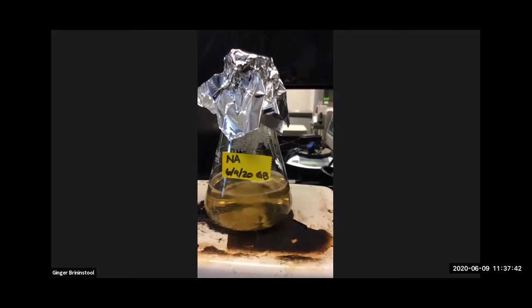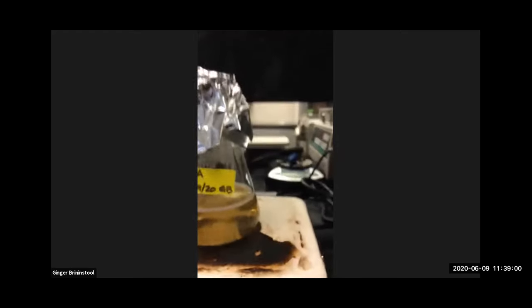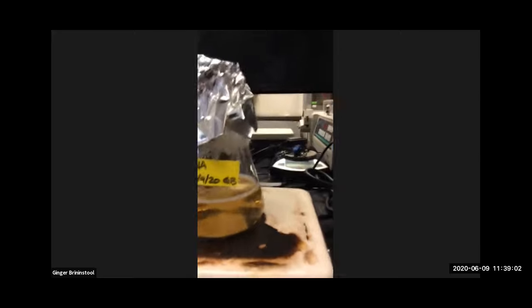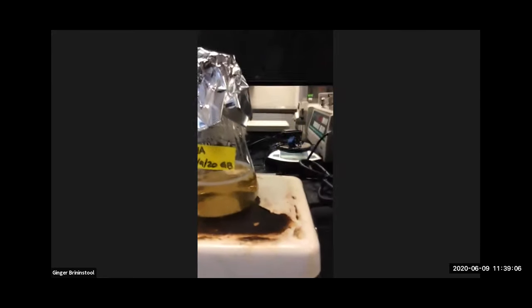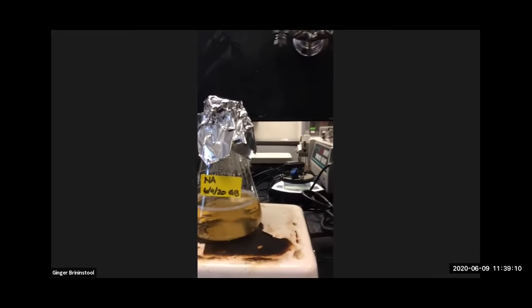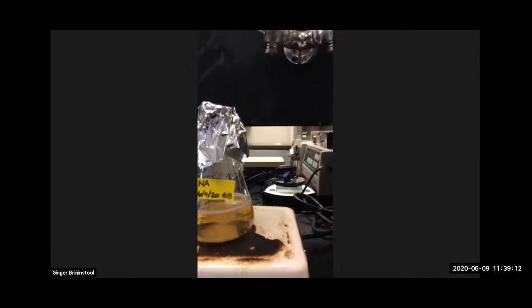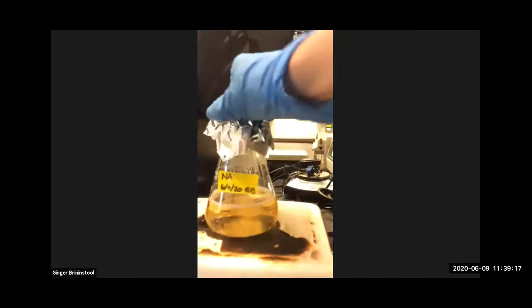All right, how's that agar looking? Can you tell it's becoming pretty clear? Yeah, I hope so. I think it looks perfect. A little bit warm, that's good. Not too warm to handle, but still, we're gonna take that flask and the other flask. You should always be super careful when handling things that might be hot. All right, so please don't burn yourself.